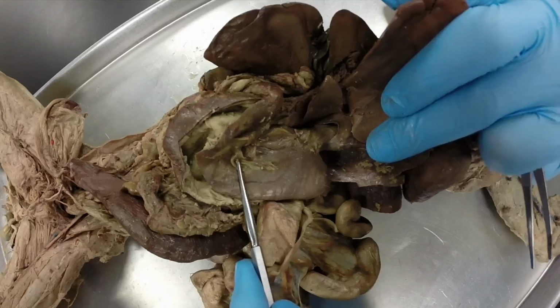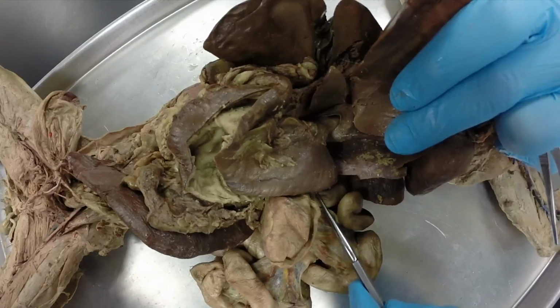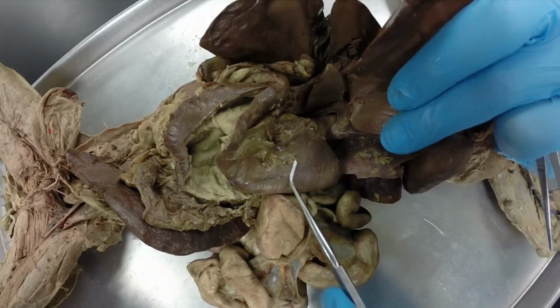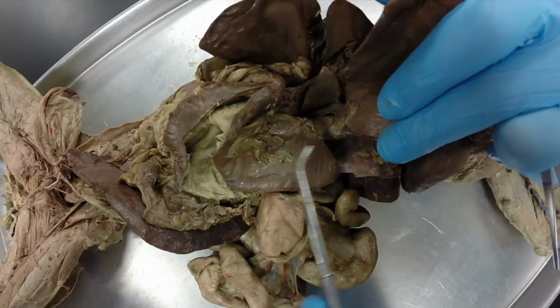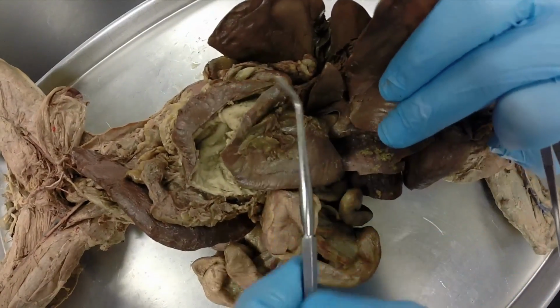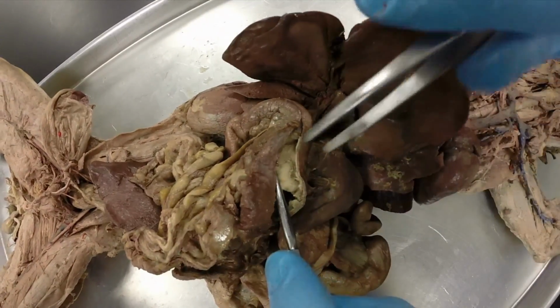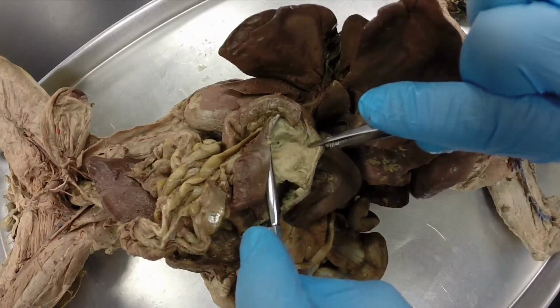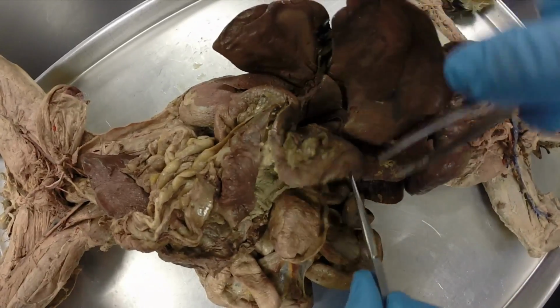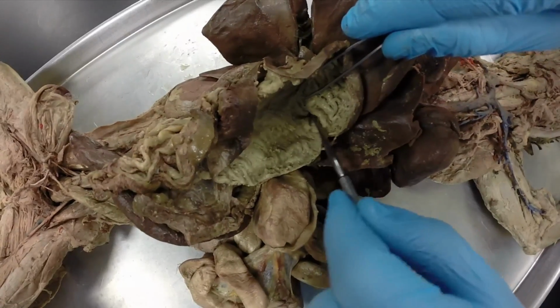And so if we look at the anatomy of the stomach, if you draw an imaginary line where the esophagus enters in, this little knob above it is called the fundus of the stomach. This area right here is called the cardiac portion or cardiac region. And then this area right here is called the body. And then where it curves, this is called the pylorus. And it's going to enter into the small intestine right here. It's going to enter in through this sphincter called the pyloric sphincter. And the sphincter is actually right there, but I've cut it. And then we also have the gastroesophageal sphincter right there between the stomach and the esophagus.